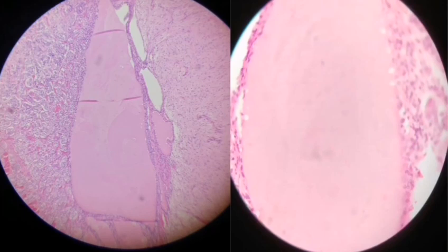So this is the nervous tissue. You can see a thread-like appearance, but these small spots are the nuclei of the supporting cells. There will be pituicytes also. Then this is the pars intermedia. You can see a big follicle, and small follicles are there. This one is a bigger follicle.